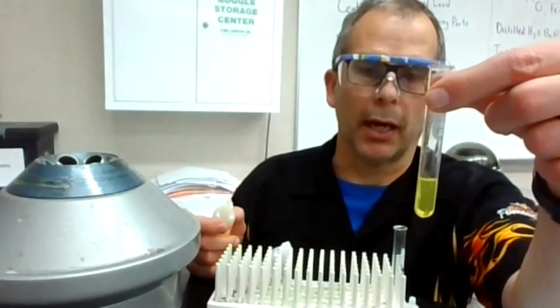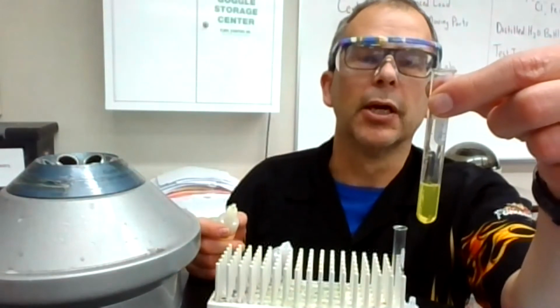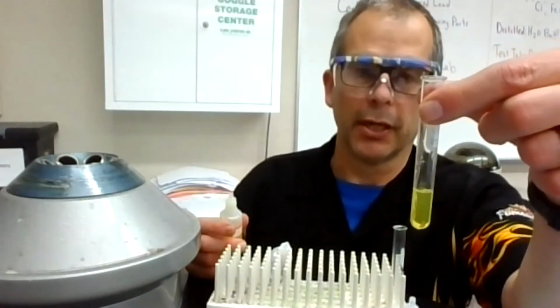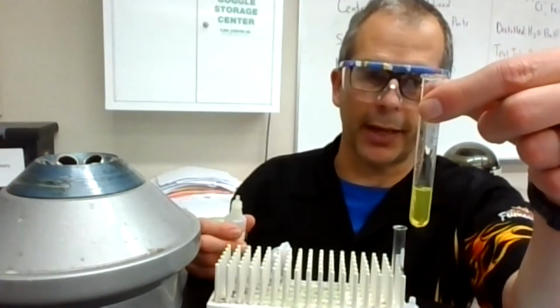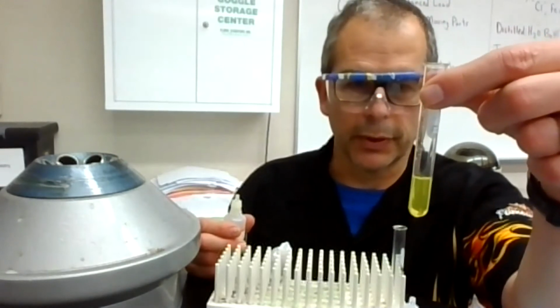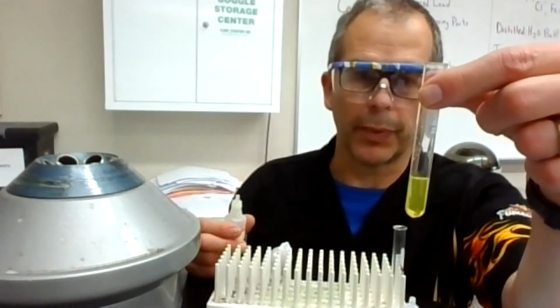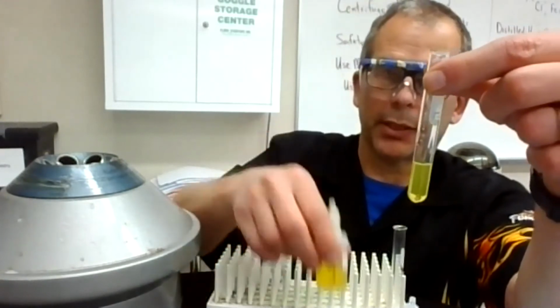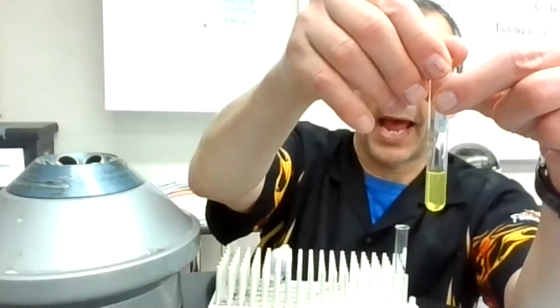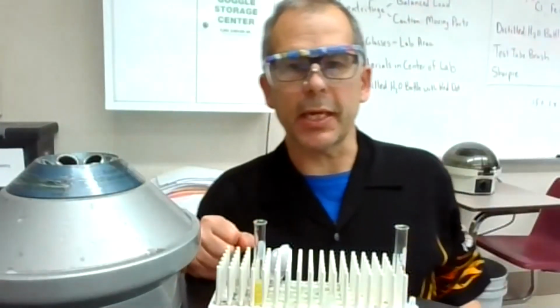It's a slight haze, and then it's kind of a yellow slight haze, but it doesn't seem to be getting cloudier. And in this final test, it should definitely get cloudy as you add the drops to be a positive test in that case. So to me, it does not look like it's getting any more hazy or picking up any precipitate during this last test.